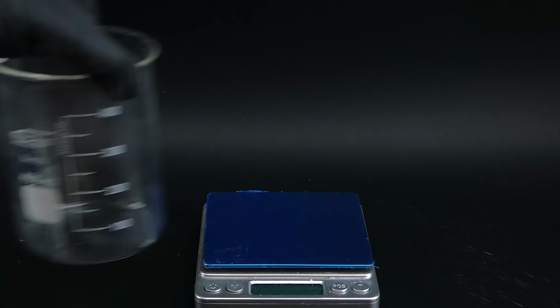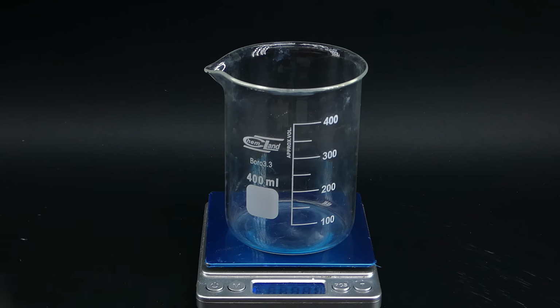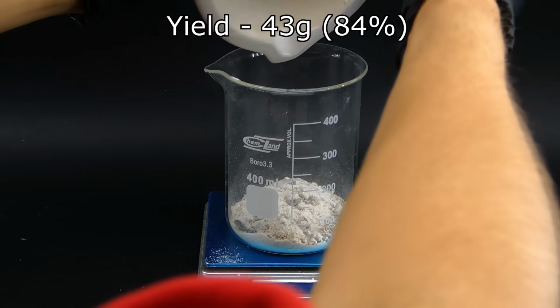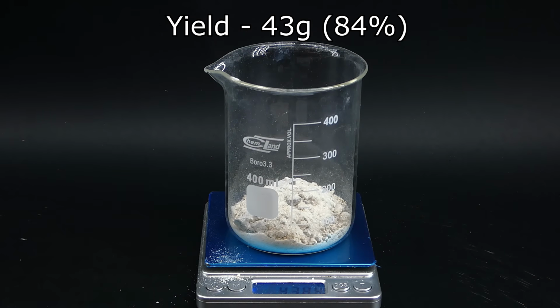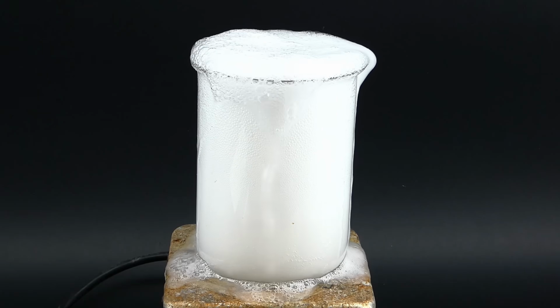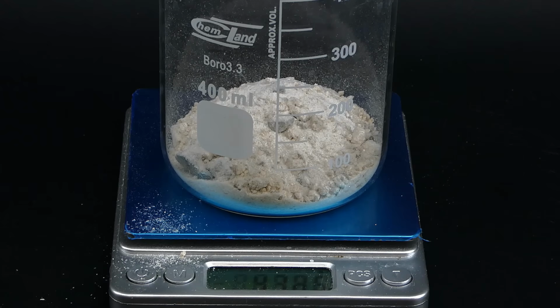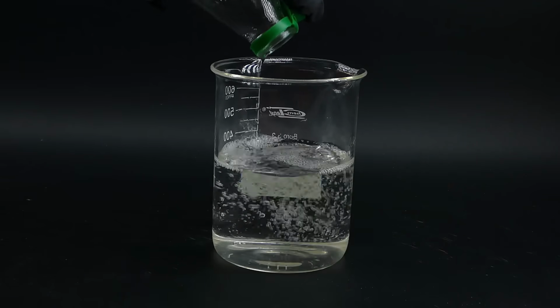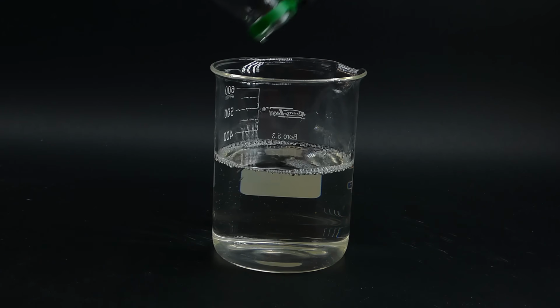After that was done, I used my scale to weigh the powder, and it turned out that I got a little over 43 grams, which corresponds to a yield of about 84%. It isn't that bad, but it could have easily been much higher if the overflow incident didn't happen. Also, for the next step in making the glacial acetic acid, I wanted to have more than just 43 grams of starting material, so I just processed the rest of the vinegar from the bottle, which meant repeating all of the previous steps.